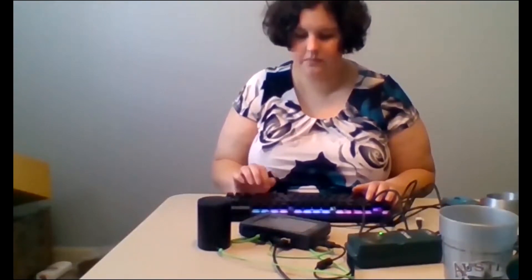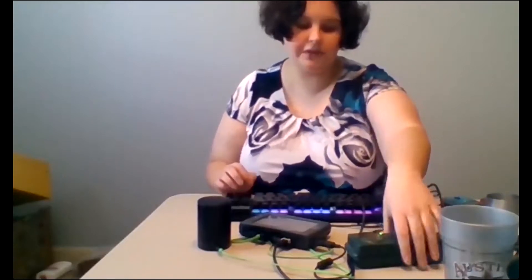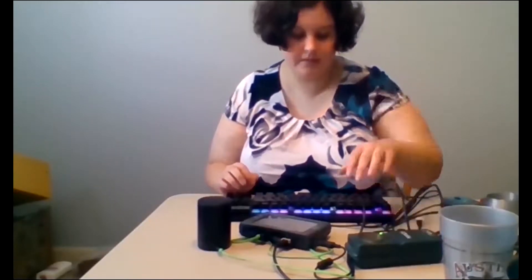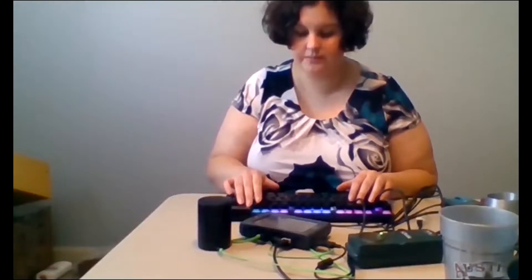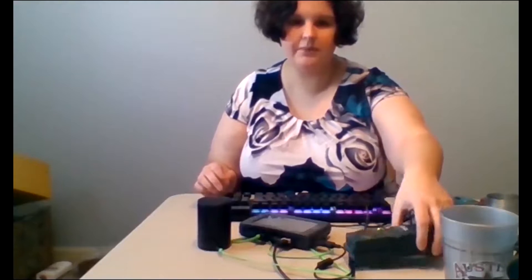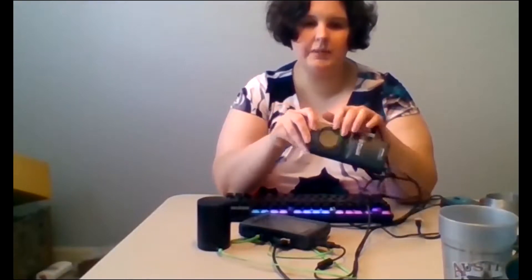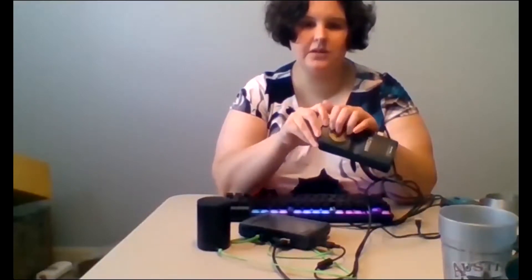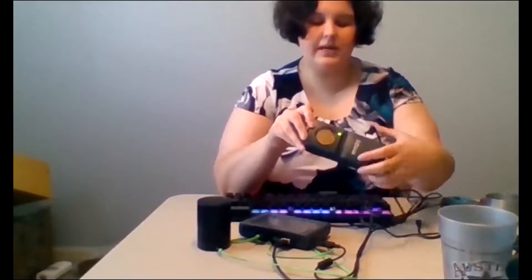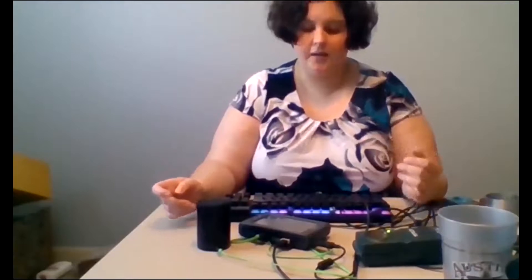We're going to go into the LabQuest application — the sensor page. The first thing on here is the sensor page, and I have hooked up right now one of our digital sensors. This is a motion detection sensor — it's a little box that has a speaker on it that makes a ticking noise, a lot like a dolphin emitting sonar.